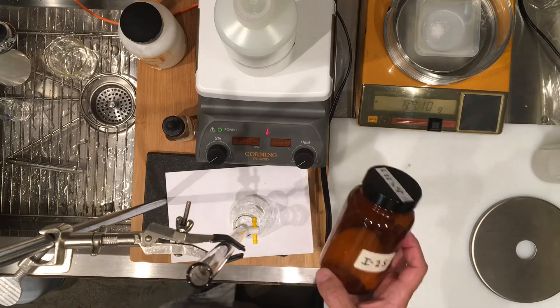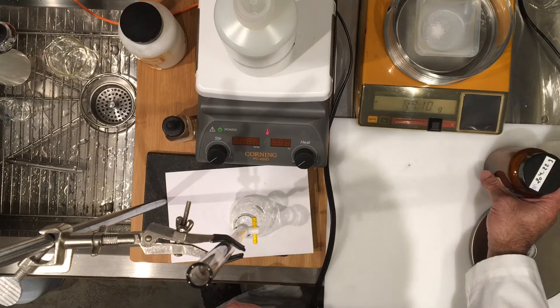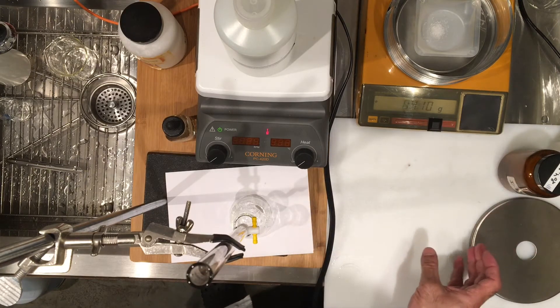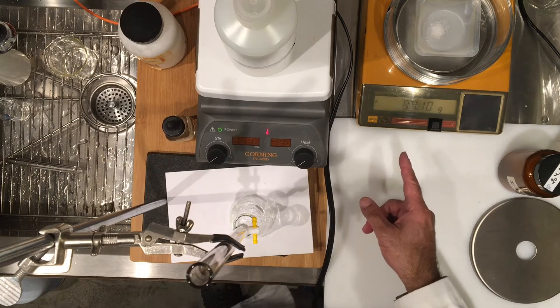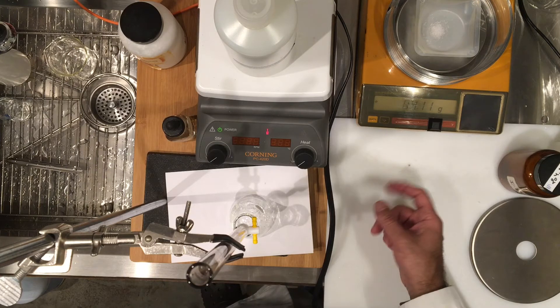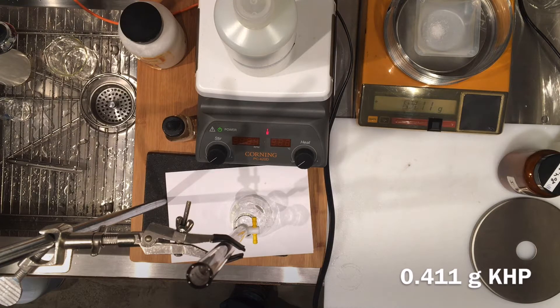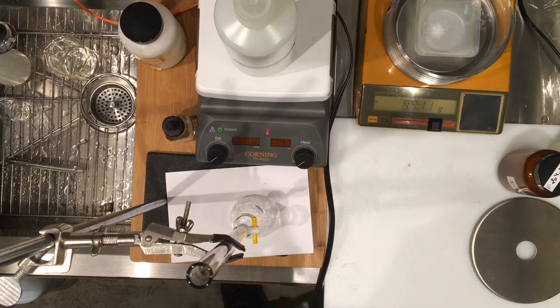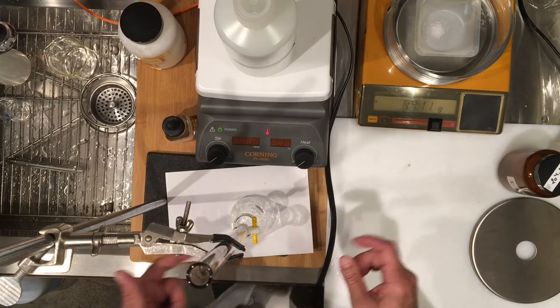I use some of this to measure 0.410 grams, so you can see the mass on the balance, 0.410 grams or 0.411 grams. Let's record that this is the mass of the KHP, 0.411 grams, and I'm going to use this mass to titrate with sodium hydroxide.